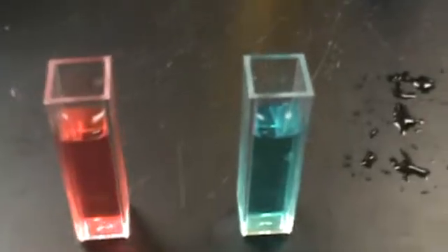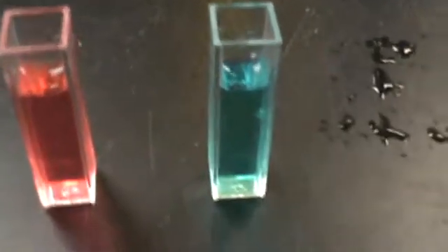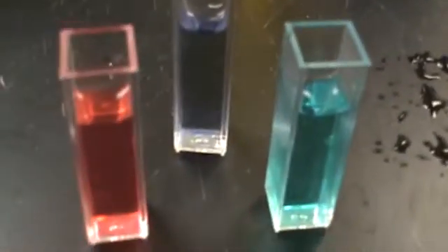I could collect the one while keeping the other one in there until later. What I'll end up with is the red food dye making it through to one and the blue food dye ending up in the other. Here we have the red 40 and here we have the blue dye one. The two mixed together gives us the purple.